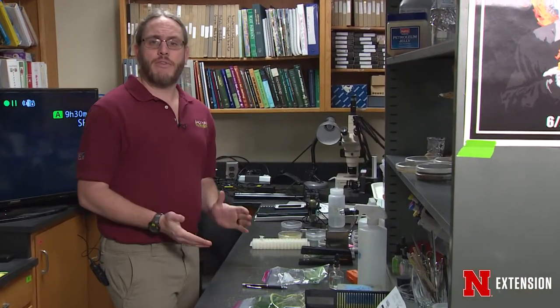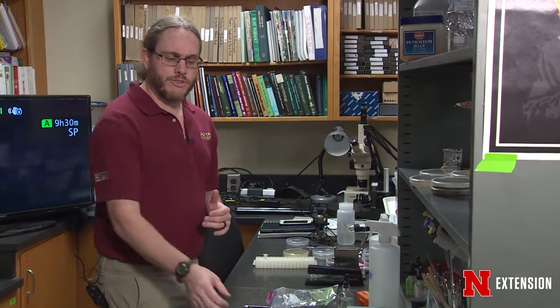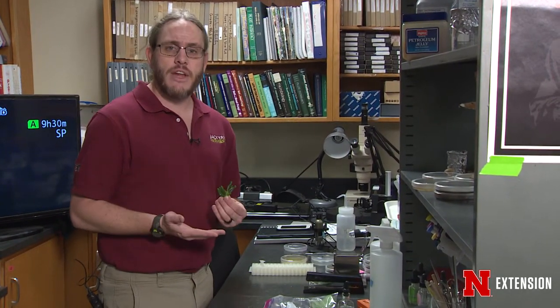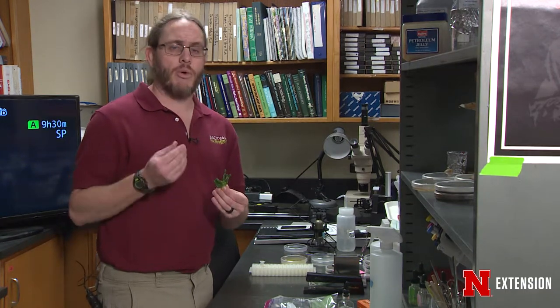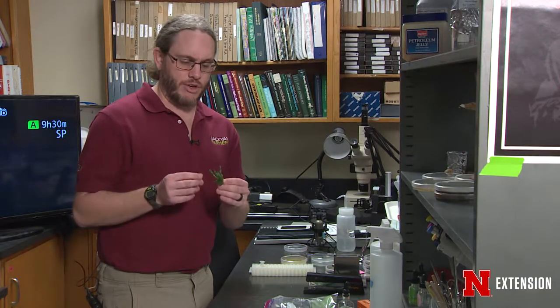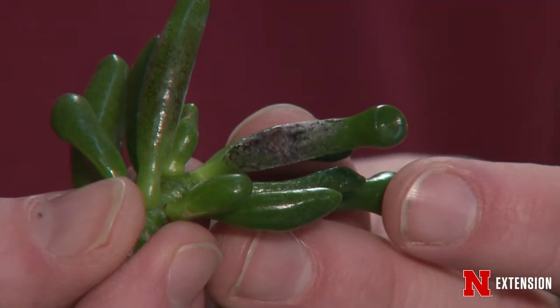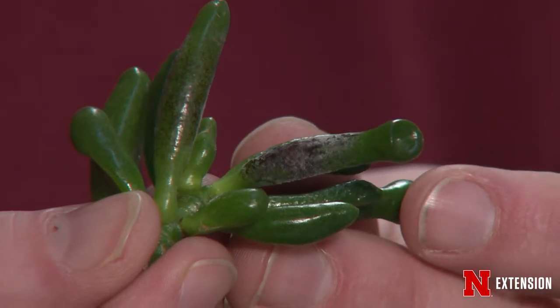When a fungal sample comes in, one of the first things that we'll do is look at the sample and see if it's actually sporulating and whether we're able to determine what the disease is based on the spore type that we see.